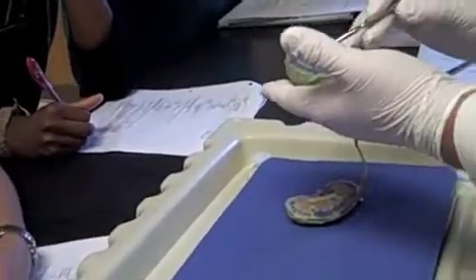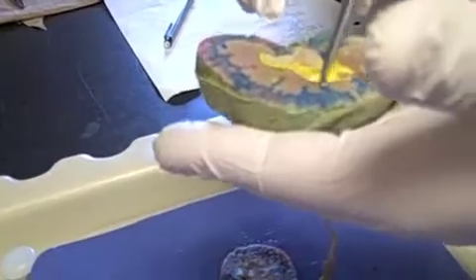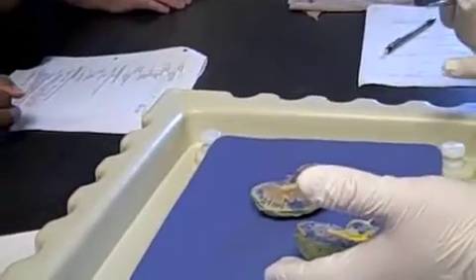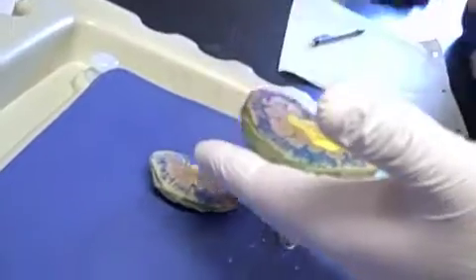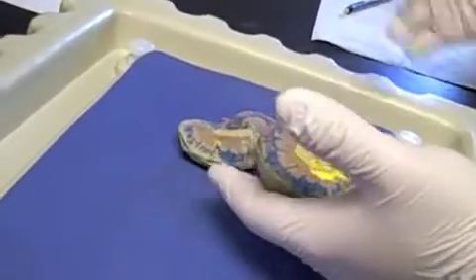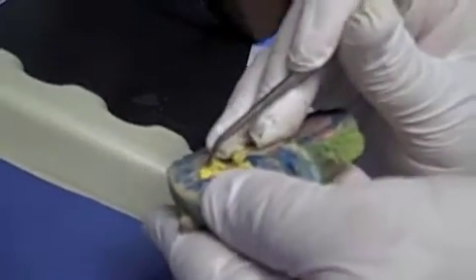You guys see these renal pyramids right here, or the medullary pyramids, some people call them, right through there. All right, you see those? Okay, that's where we're going to see urine being collected from the cortex, okay, right through here. And we'll talk about how that process happens in lecture. All right? But as urine is being collected and traveling through the renal pyramids, they will eventually run into the minor calyces right here, this first area in yellow.